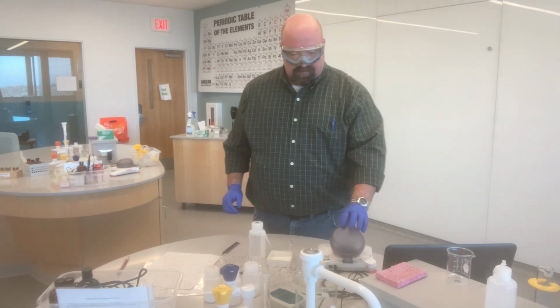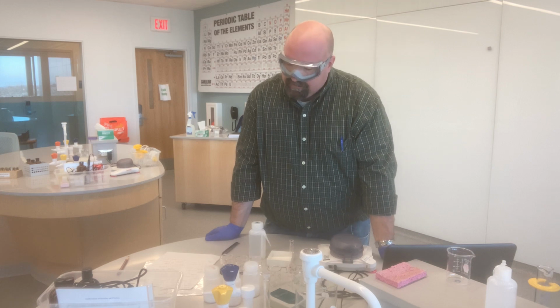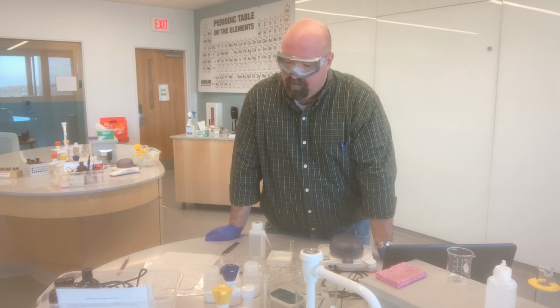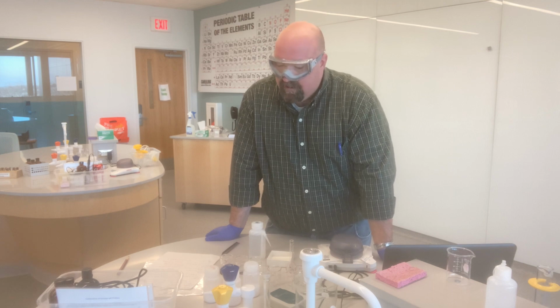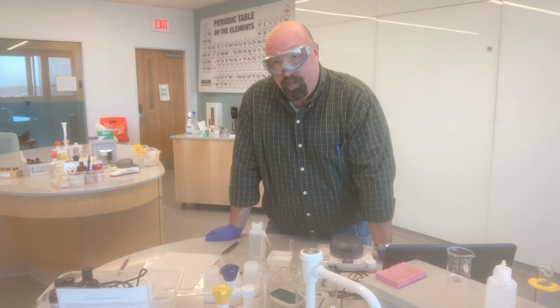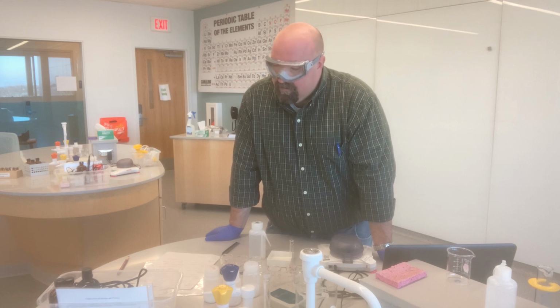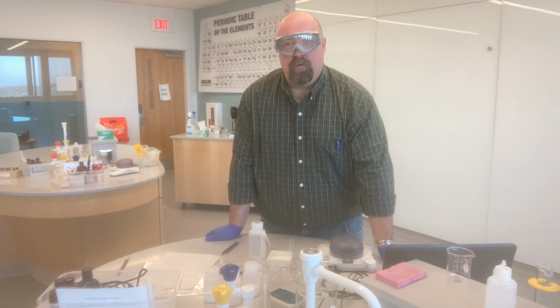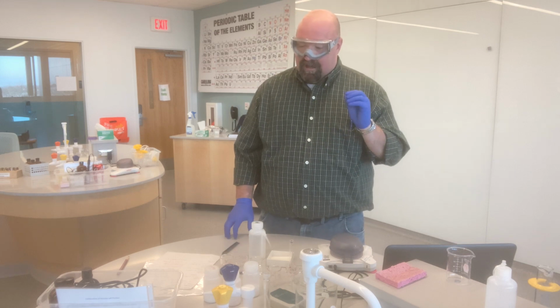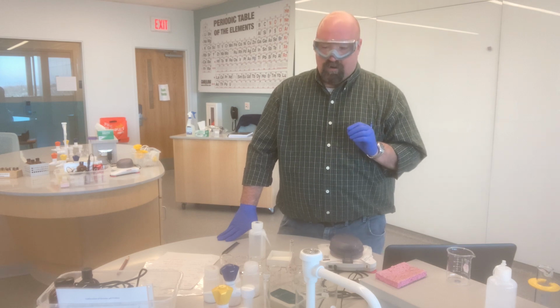Okay, so the next thing that I need to do, so those are all of the solutions that I needed to make from a solid. I now need to take some of the NH4NO3 solution, the 0.025 molar, the 100 milliliters I made, and use that to dilute some down and make 25 milliliters each of a 0.02, 0.015, and 0.01 molar solution. So again, this is where I previously calculated using our C1V1 equals C2V2 dilution equation. I calculated how much of the 0.025 molar stock solution I would need in order to make each of those solutions.